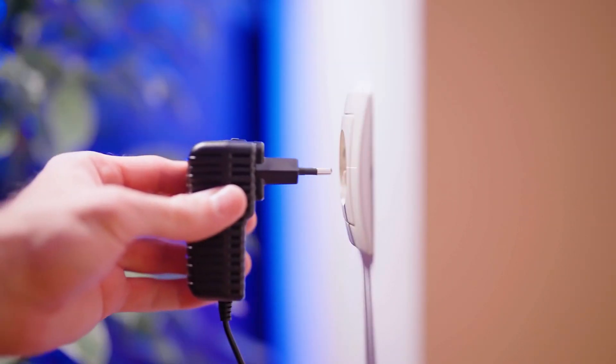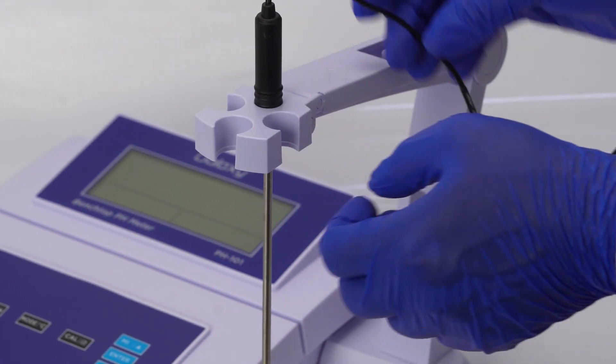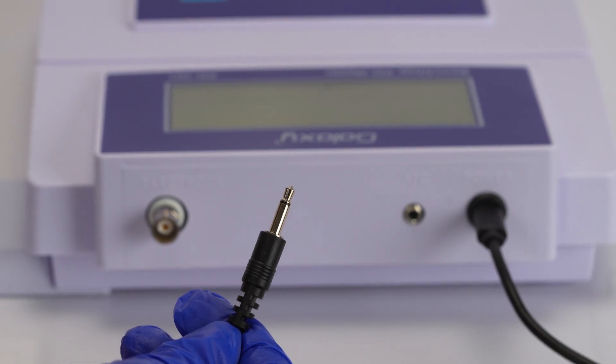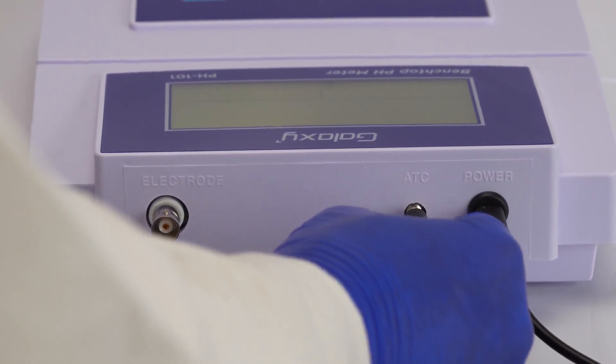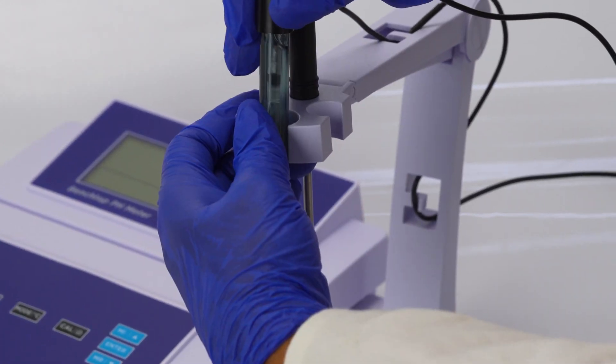Place the temperature probe into the circular hole at the center of the electrode arm and insert the jack plug into the ATC socket. Ensure a snug fit.